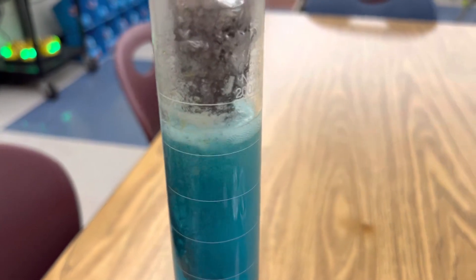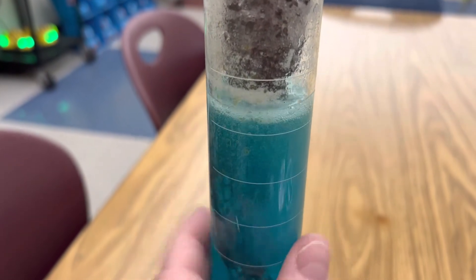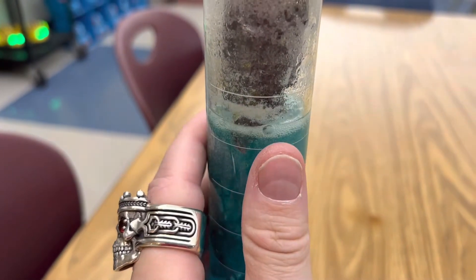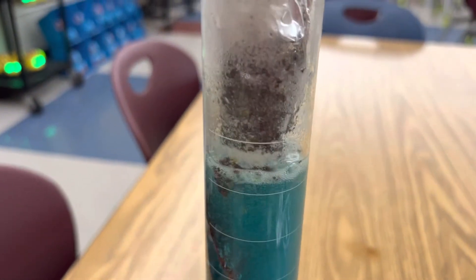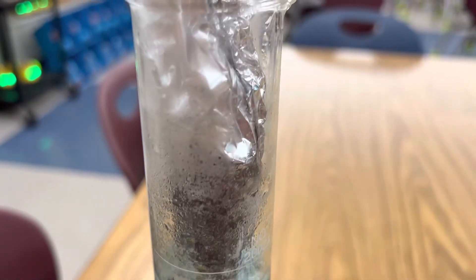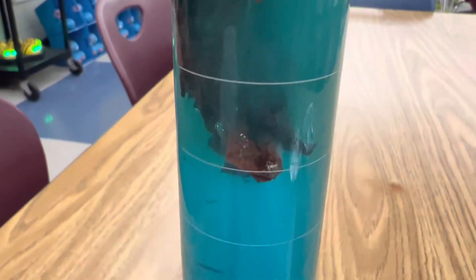You can see it's starting to bubble. This is an exothermic reaction — you can definitely feel quite a bit of heat coming off of it. And there's the copper — you can see those brown pieces of copper falling down in the solution.